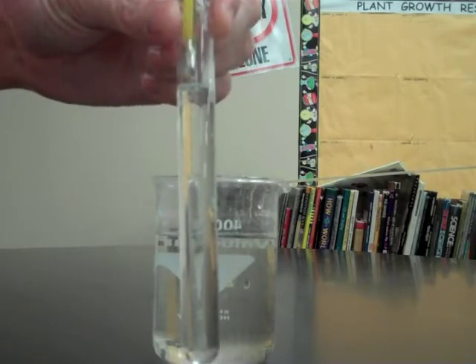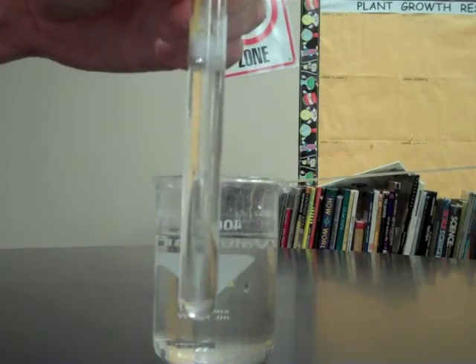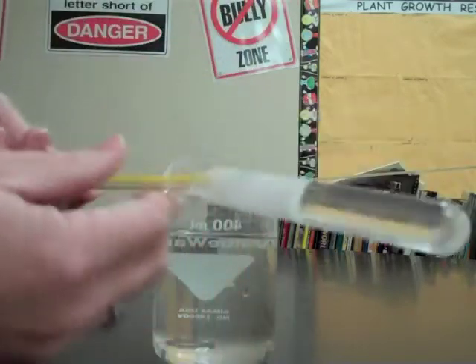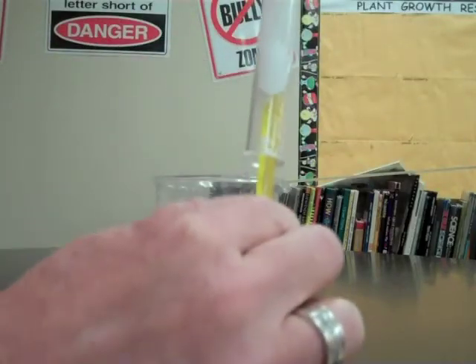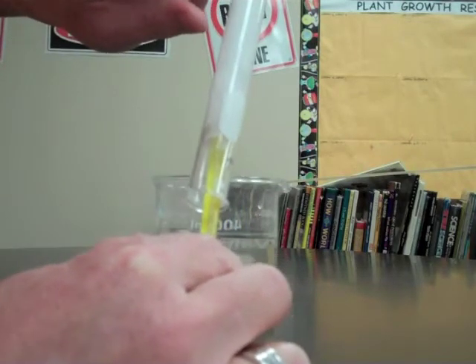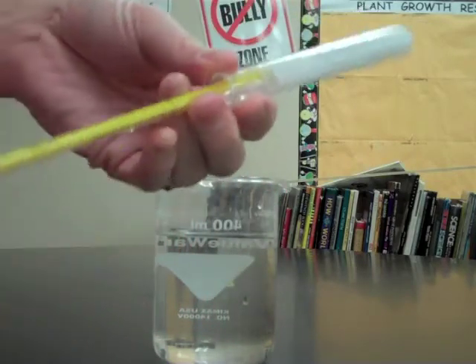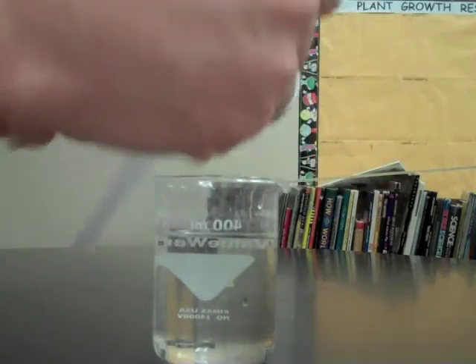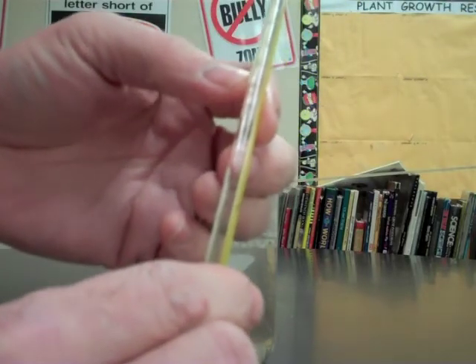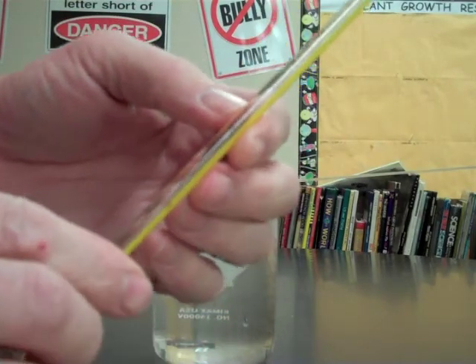I want you to notice what happens immediately after I put the thermometer in the test tube. And there we go. Are you seeing it? I can turn it upside down or sideways. It is actually hardening as it goes up. The thermometer is wedged in there because it created an immediate solid. The temperature now has risen to an amazing 60 degrees and it is still climbing.